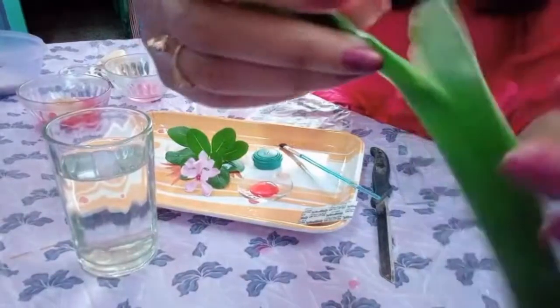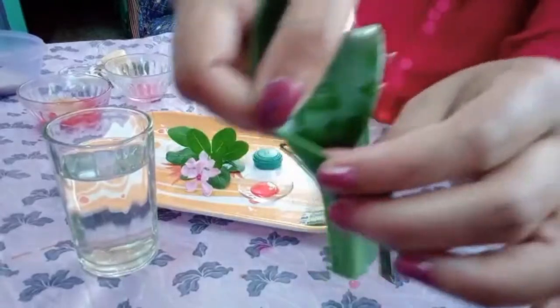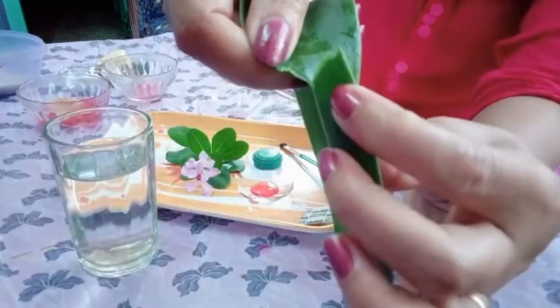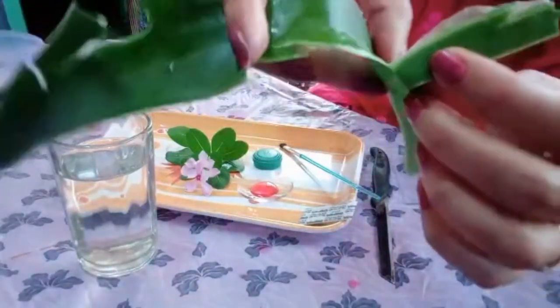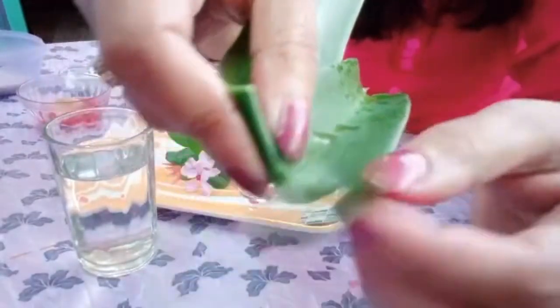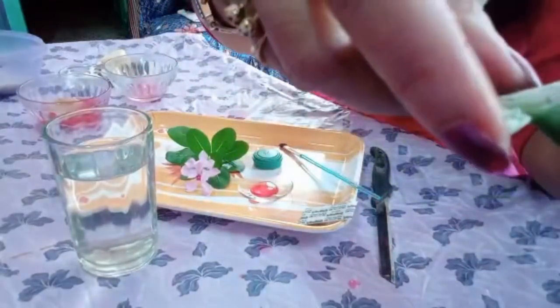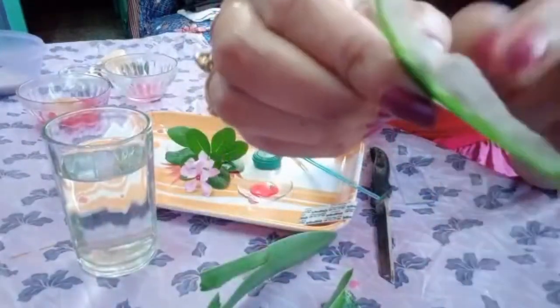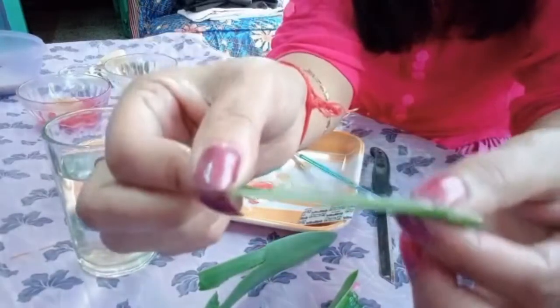See, the technique is very simple. You cut it, take an angle, just follow an angle and then start removing. But while removing, be careful enough. Twice or thrice you need to practice. Can you see the transparent region? Try to follow the transparent region. This region, which is very much transparent, I am removing it to show you very clearly. This is the layer that we are looking for, and our whole experiment will be based on this.